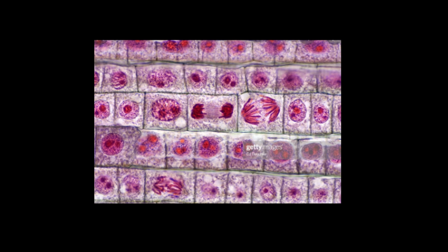What you're going to do is move the pointer and the slide so that the black tip pointer is over one of the cells that you have located. Then you're going to call me over and you're going to say, Mr. Curtis, I think that this is, and then tell me you think it's metaphase or anaphase or whatever. And then you're also going to say whether you think it is early in the stage, middle of the stage, or late, because these go slowly through each of the stages.